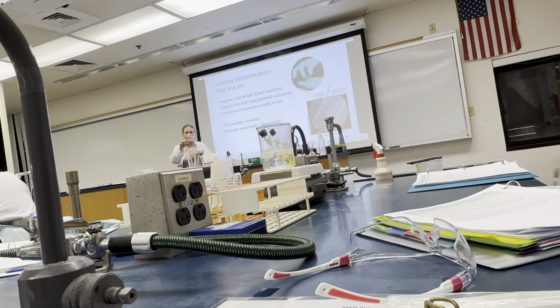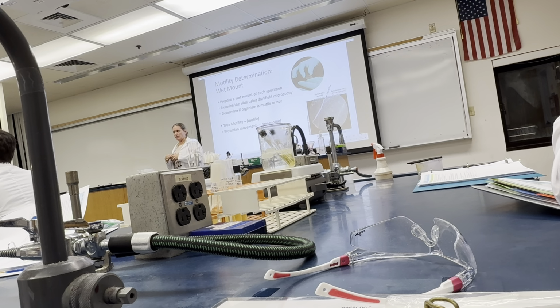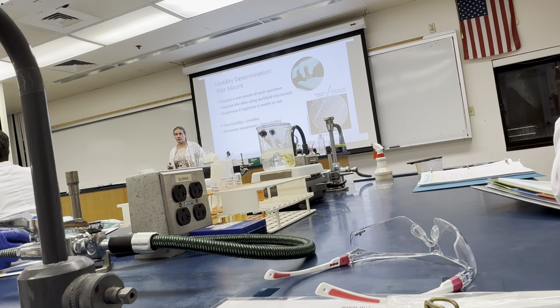With both of these organisms, you will see movement. If you see no movement at all, okay, that's a problem. You're probably not looking at the organism. Just call me over and I'll make sure you're in the right field of view. But keep in mind it's the same thing throughout the entire term: all the way up, quarter turn down. Okay?